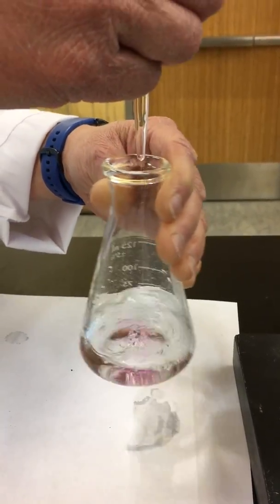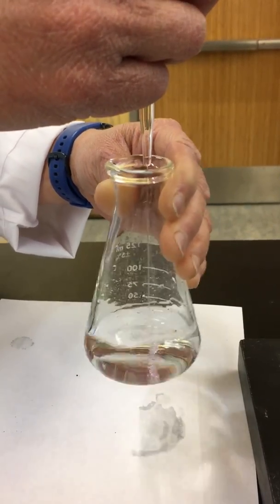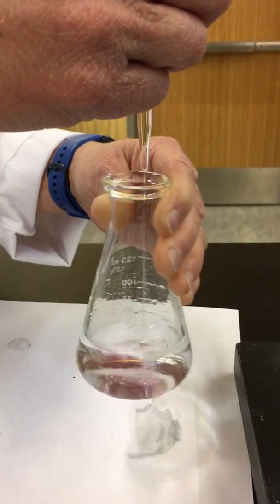So now we can start to see that pink color is forming, lasting a little bit longer. We know we're getting closer to that endpoint of titration.